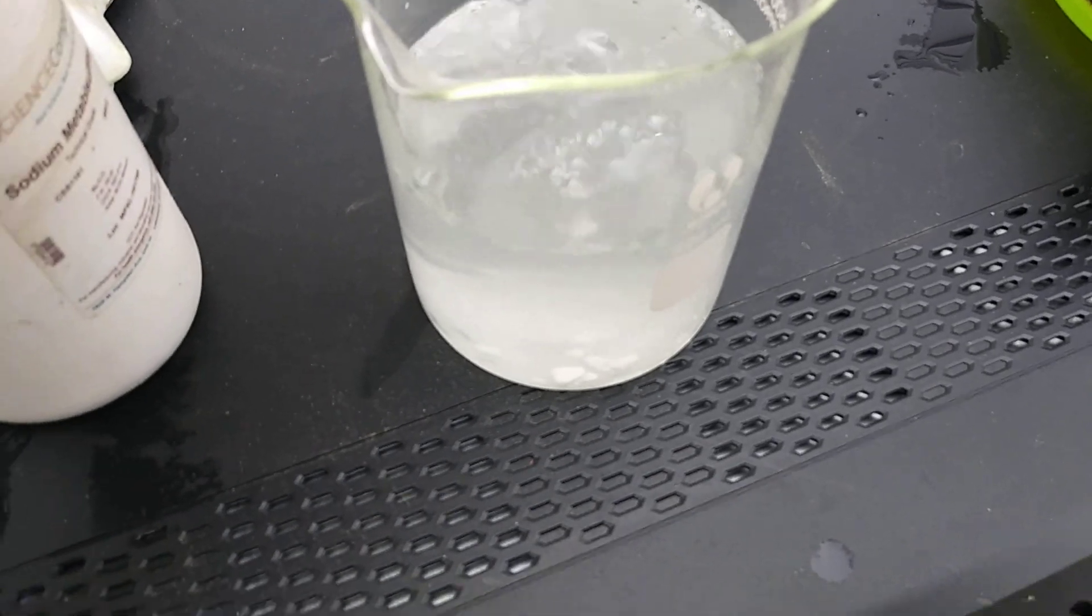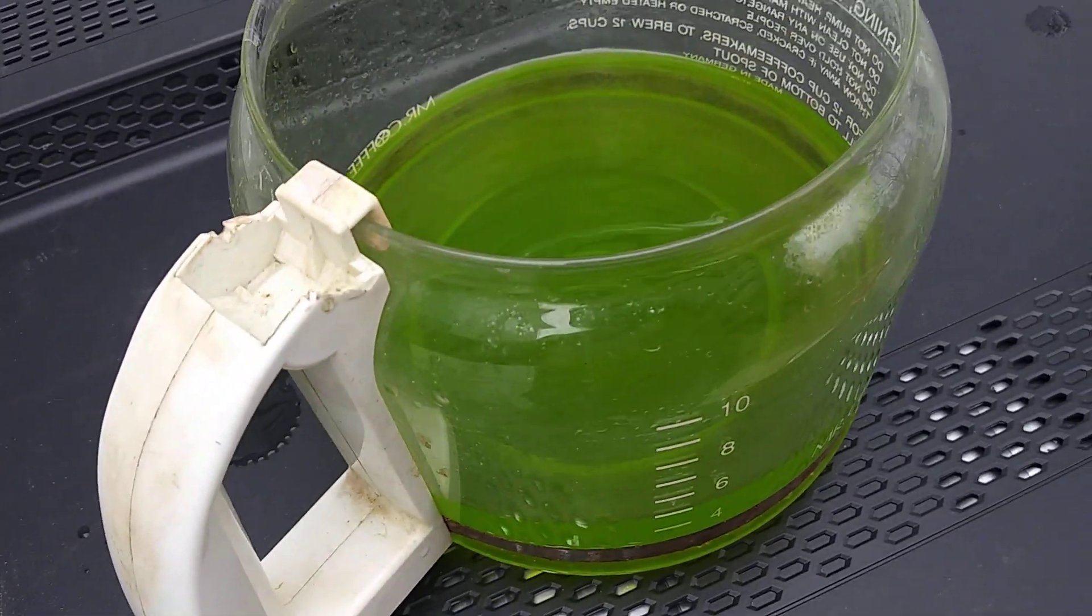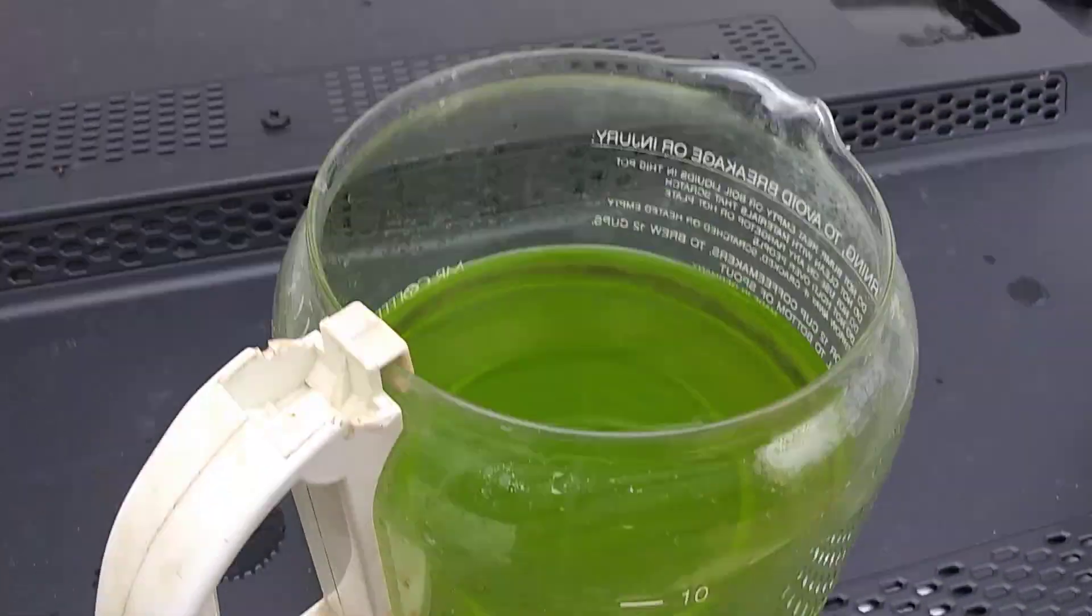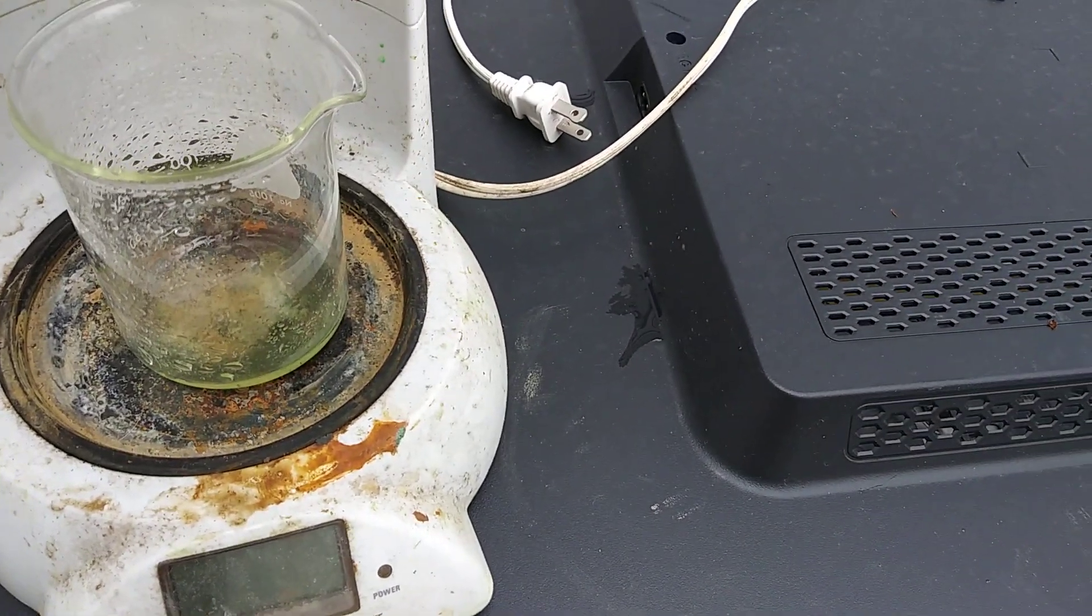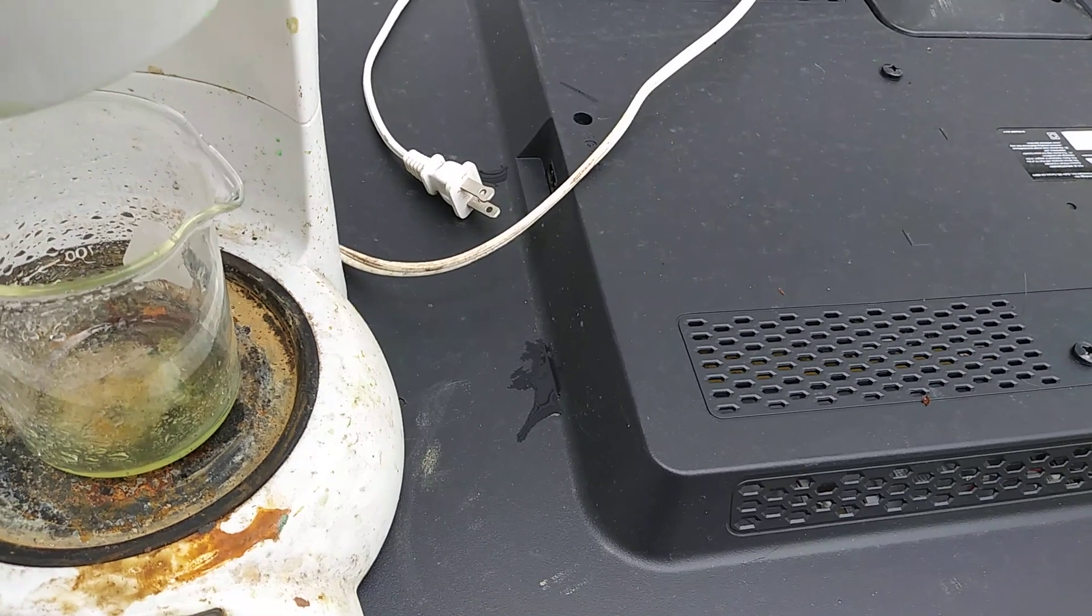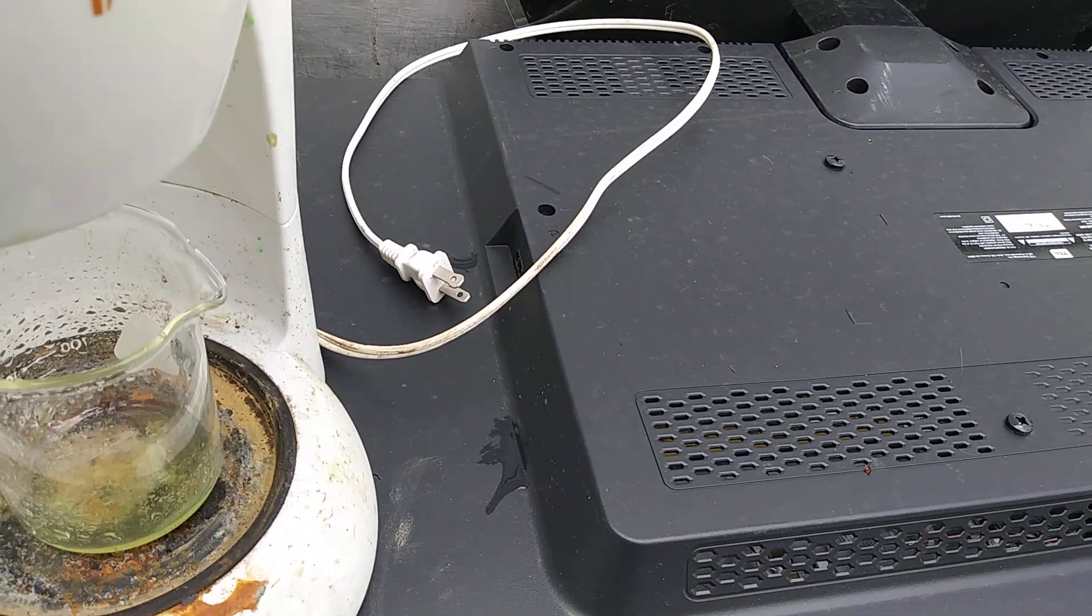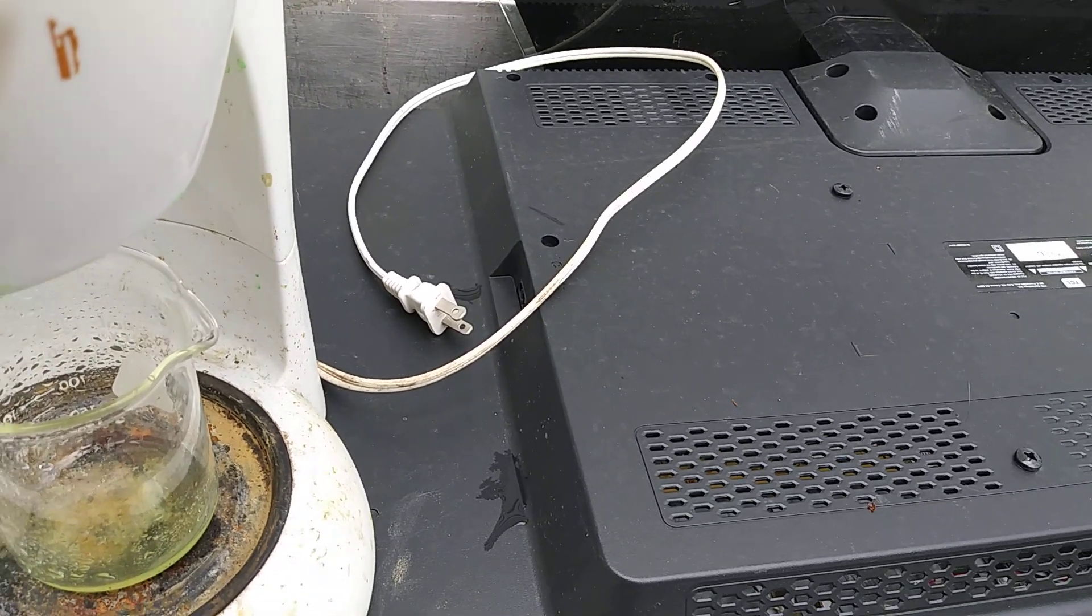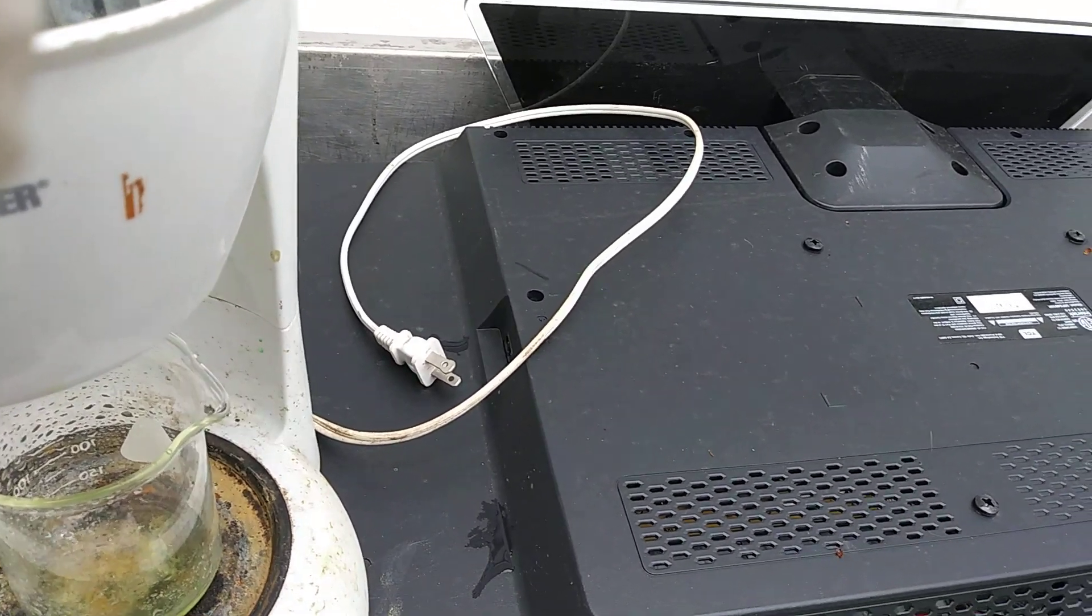But what will happen is when I pour this solution into that solution, that solution will turn almost black. Let's see if I can hold this phone without dropping it.